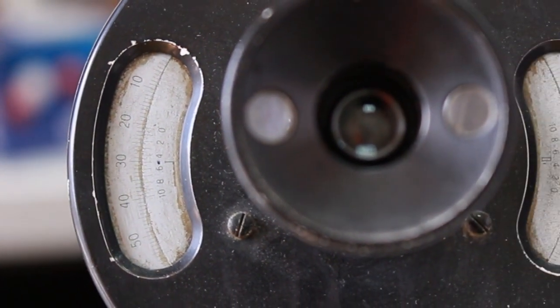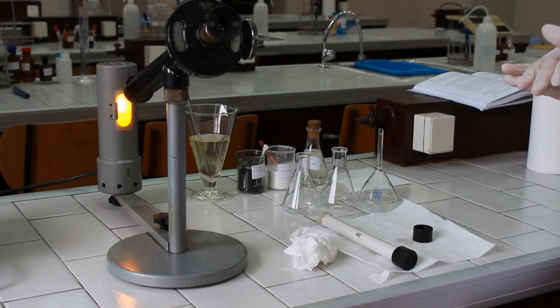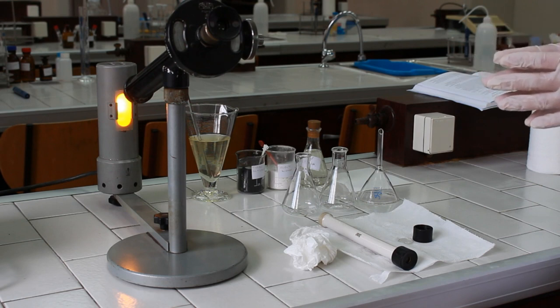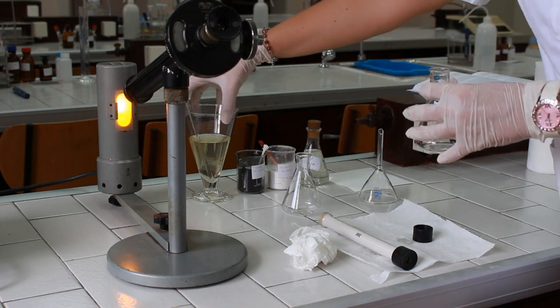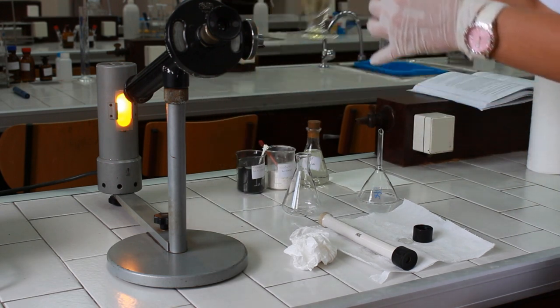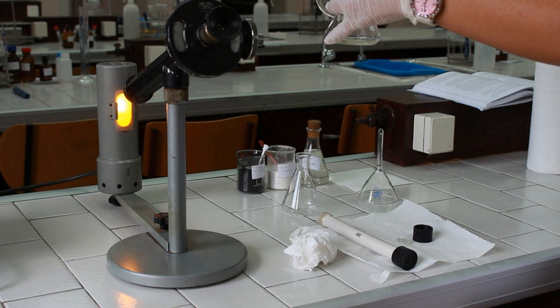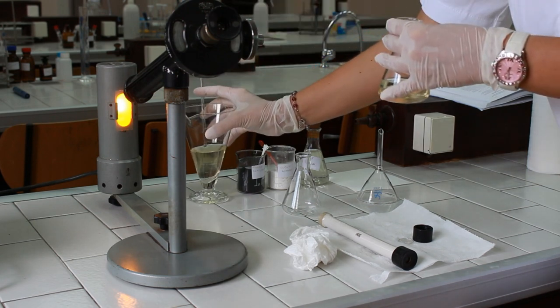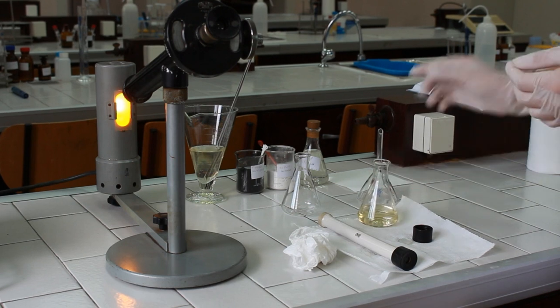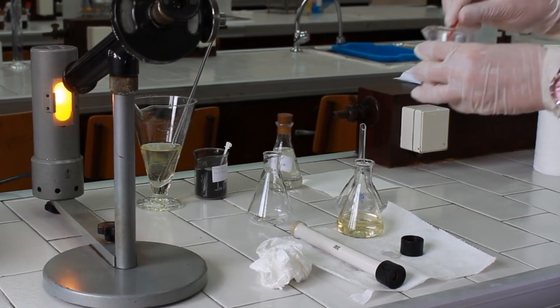Using the equation provided by the manual, calculate the specific angle of rotation. The third part of the experiment is the determination of glucose levels in a urine sample. For that purpose, we are going to take approximately 50 milliliters of urine and pour it into an Erlenmeyer flask. In order to precipitate any possible suspended substances, we should add one or two small spoons of lead acetate.